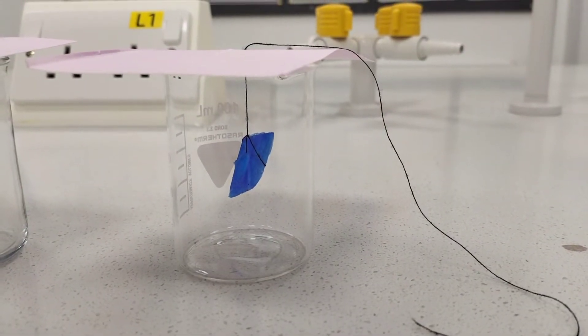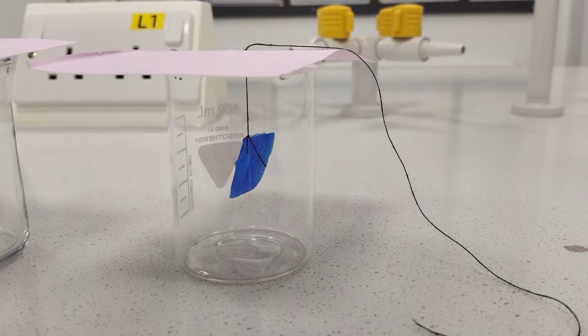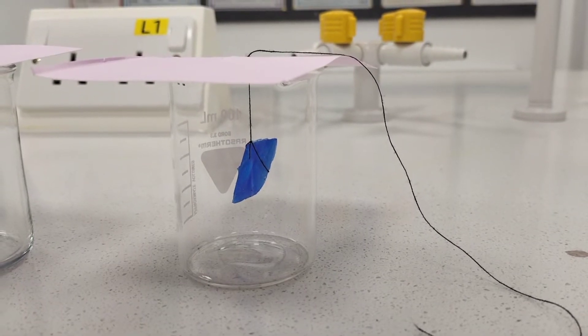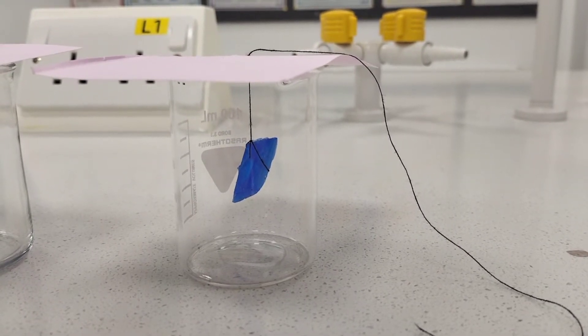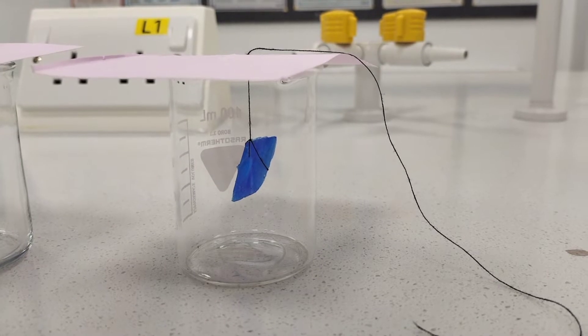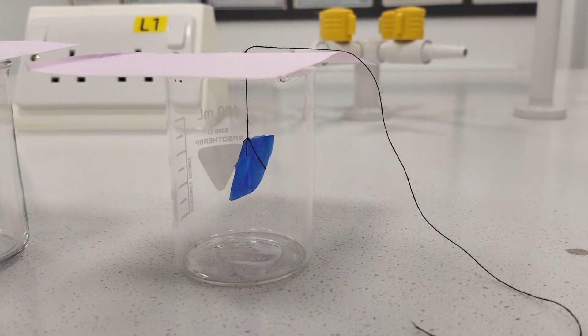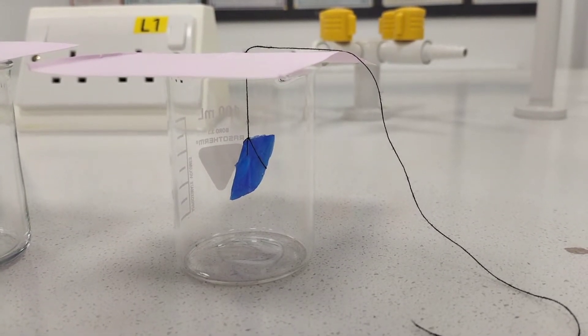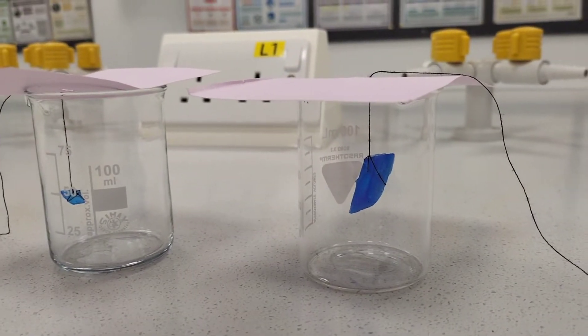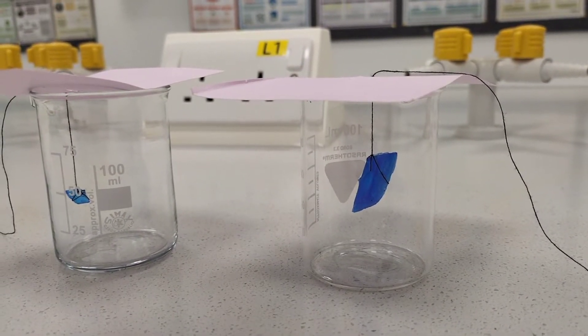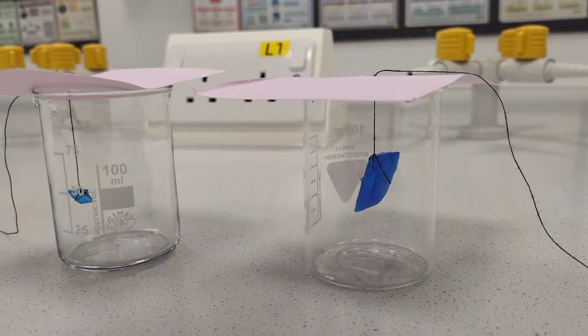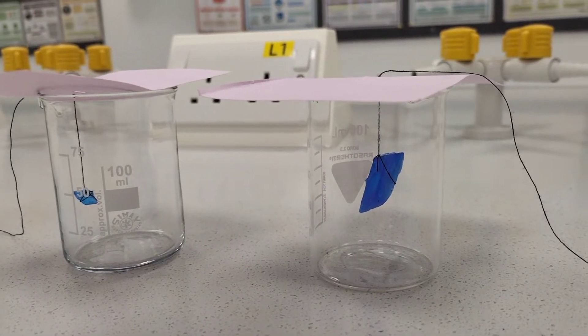Just to the right of the previous crystal, I've got a much larger crystal we've been growing for a while, also suspended from a piece of string which I can move around to lower it into a saturated solution of copper sulfate. Over time, both these crystals will grow larger. I'm going to see comparatively which one grows larger in the time provided. Let's get started.